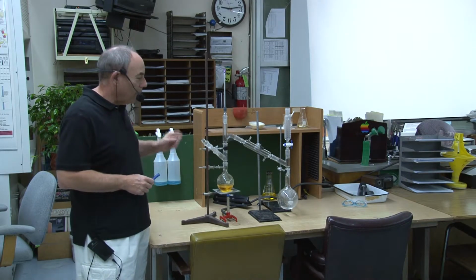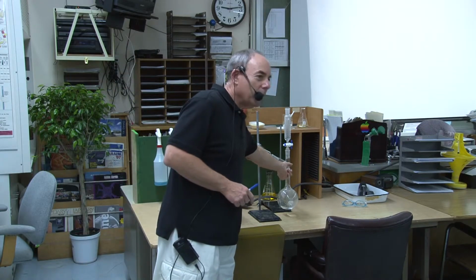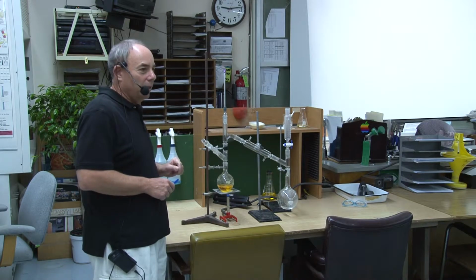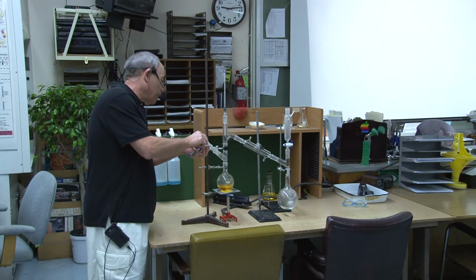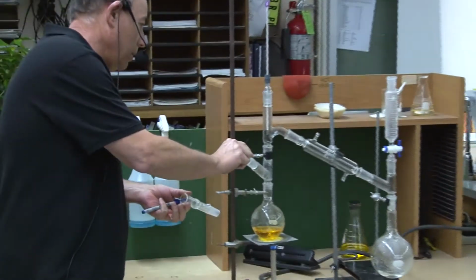Yeah, no, what I should have is that other piece inserted in between here, okay? And this one closed off. This should be completely closed off on that side. See, I could probably take this off like this and put that right there.